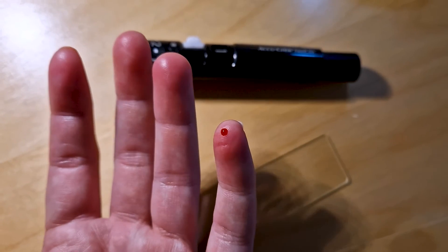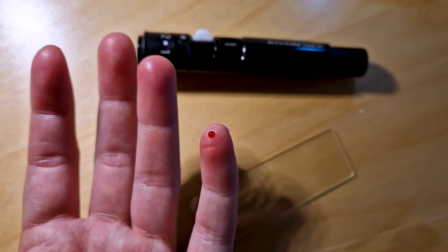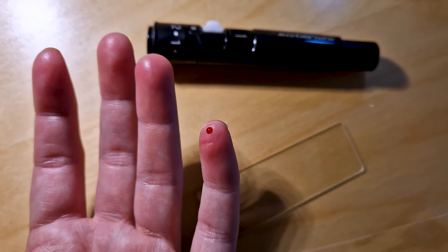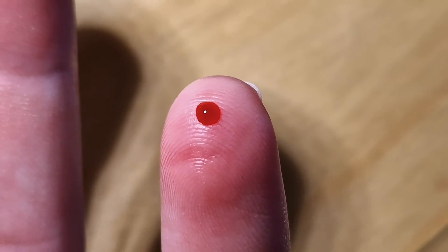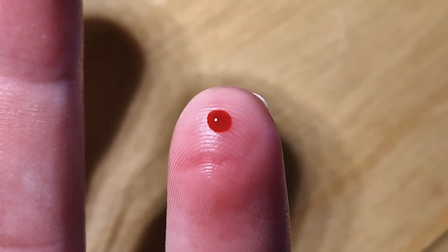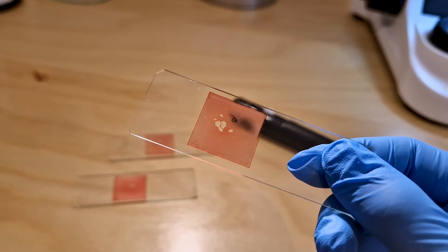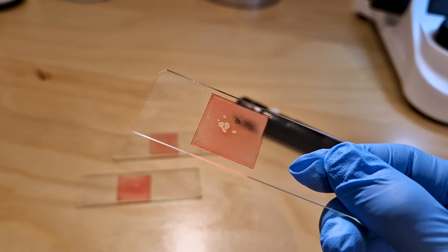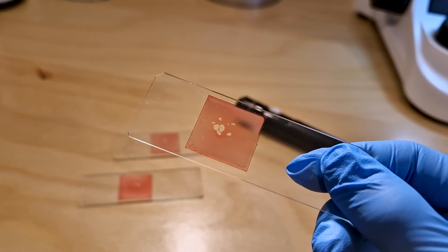So for this episode, I sacrificed myself quite heroically and pricked myself with one of those little needles that diabetics usually use to test their blood sugar. I then put the drop of my blood on a slide, as you can see here. Now let's take a look at it under the microscope.